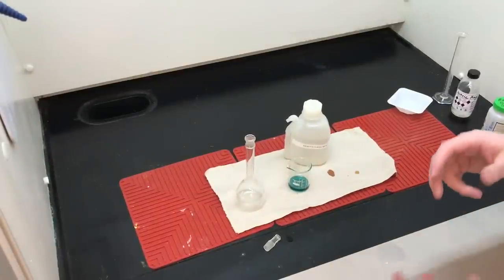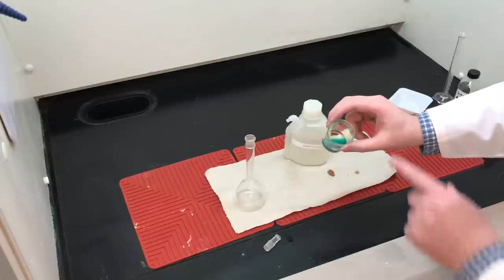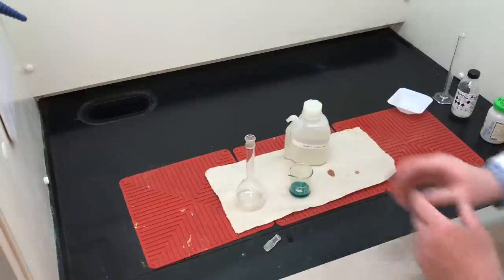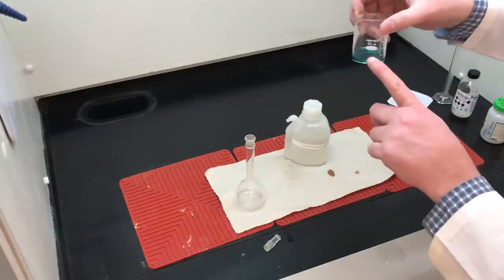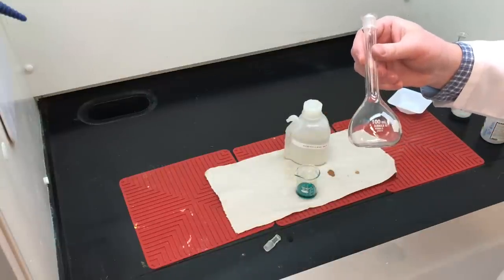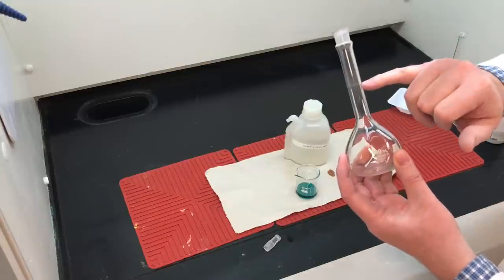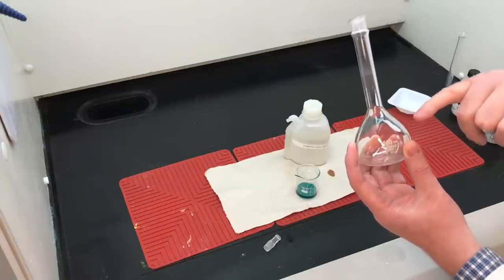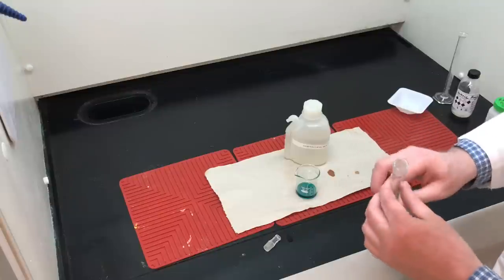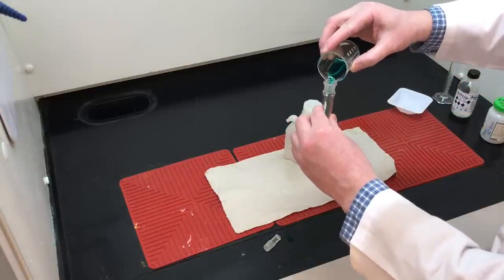The brass has had about 10 minutes to sit in the concentrated nitric acid. I used an excess of acid to ensure it would dissolve completely, and I don't see any evidence of undissolved brass pellets. So now we have a solution of dissolved brass — you can see the color is a turquoise, greenish-blue. I'm going to take a 100 milliliter volumetric flask and transfer the dissolved brass solution into it.